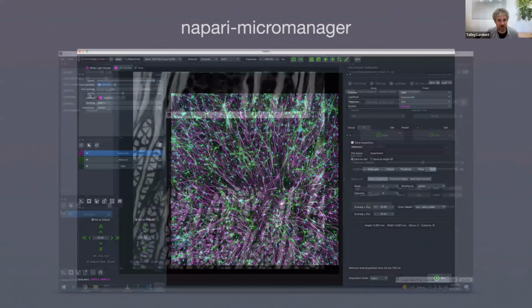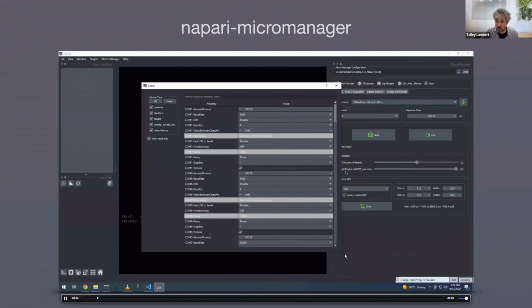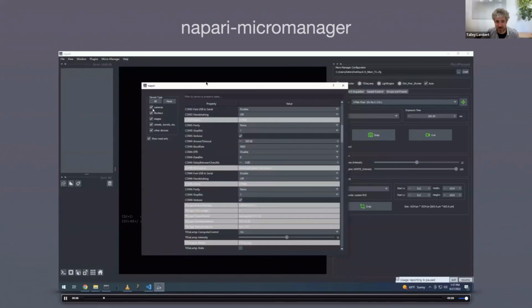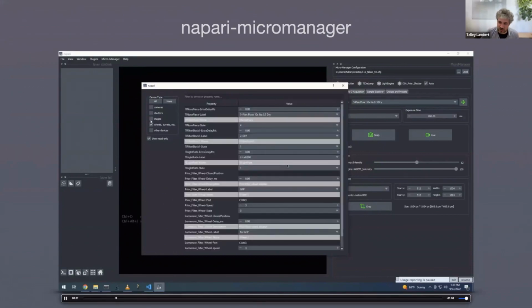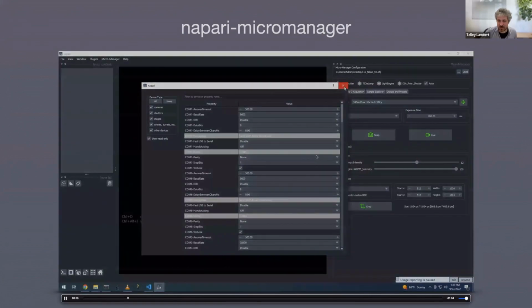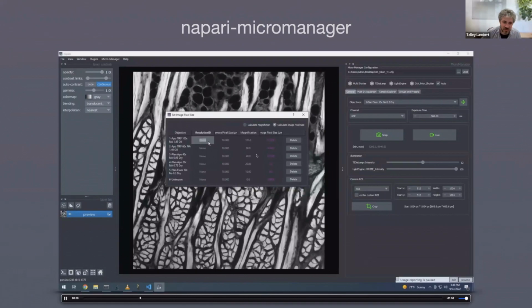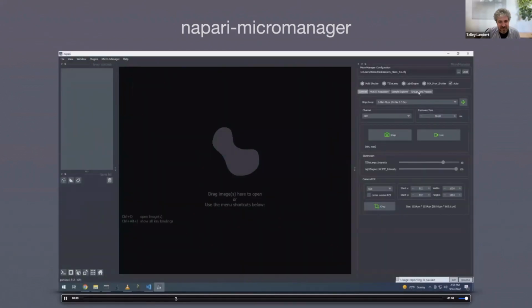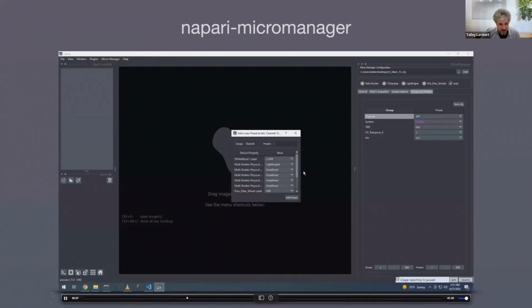And I will show you a little video here. I might skip through some of this, but this was taken a while back when the GUI looked different, just to give you a sense. So here is the device property browser that is very familiar if you've used Micromanager. You have all your devices and you can actively control their settings. There is a pixel size calibration, which is, of course, going to be important if you care about the size of anything. And so here's an example, let me pause this.